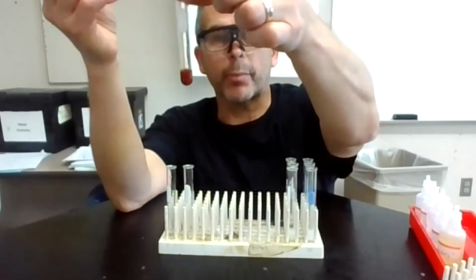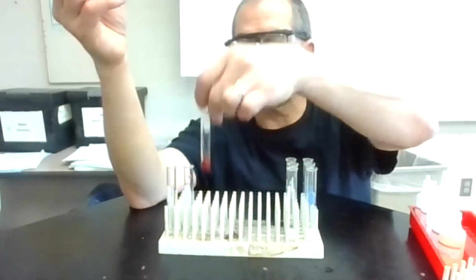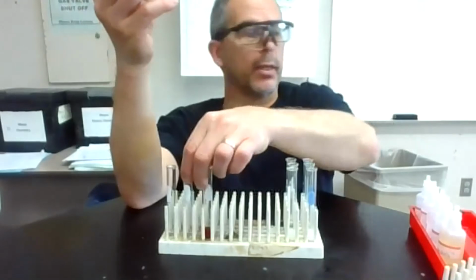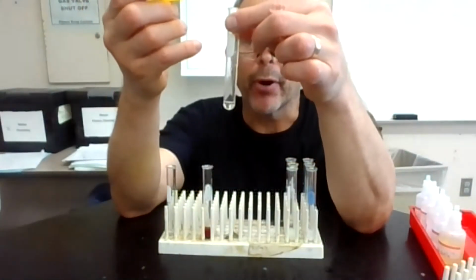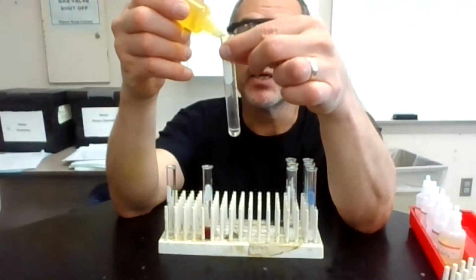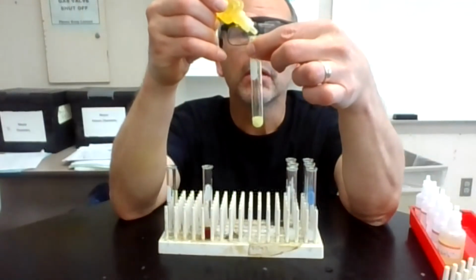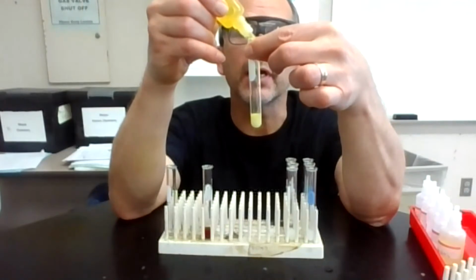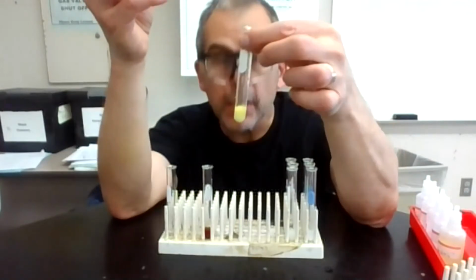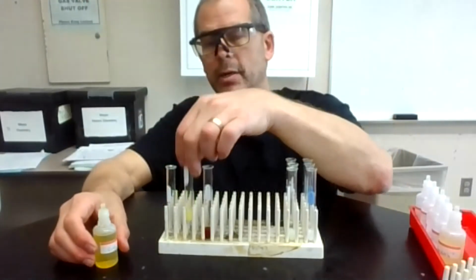It's probably hard on the black backdrop to see that, but against the white, it's actually a deep red color that we're getting. Okay, the next reaction I'm going to do is the barium, and clearly there's a precipitate here. It's cloudy, it's kind of a yellow solution, but it looks like a precipitate that's going on here.